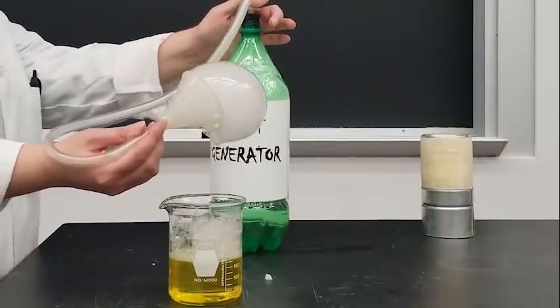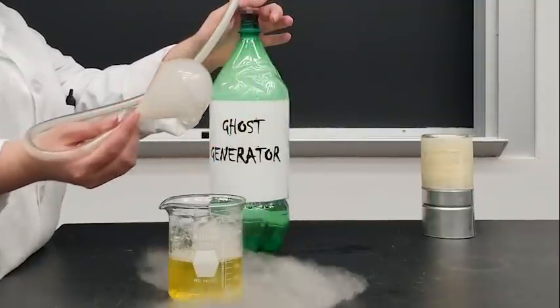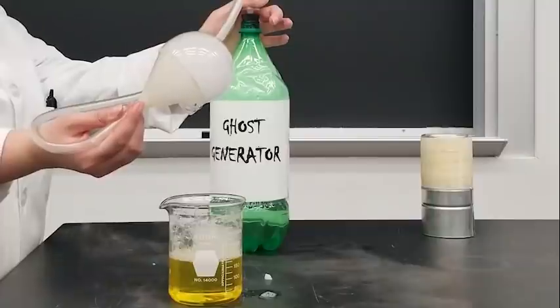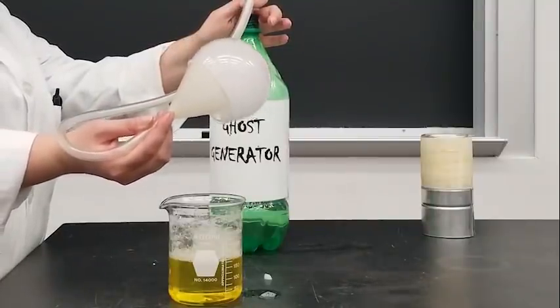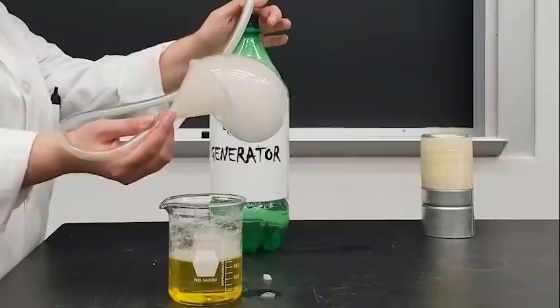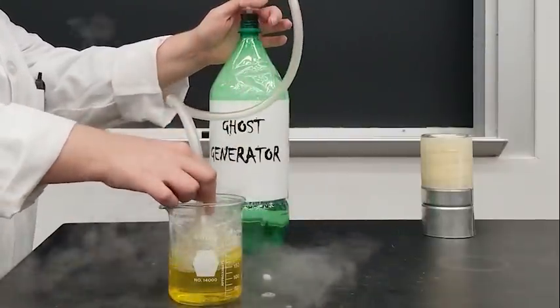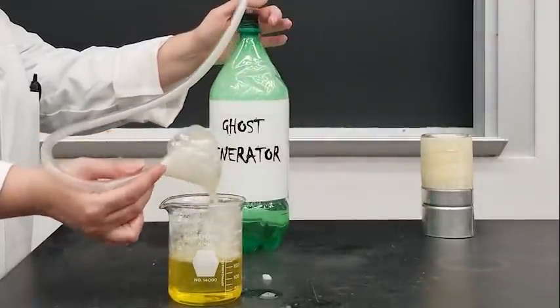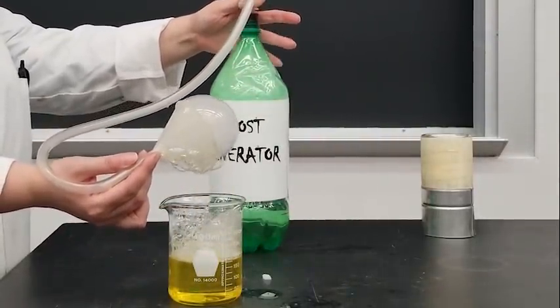Carbon dioxide is heavier than air, so when I shake this off, it's going to fall. A lot of ice cream stores sell dry ice, so if you're careful and you practice good safety with dry ice, you can do this at home. All it takes is some tubing, a cork, and a bottle.